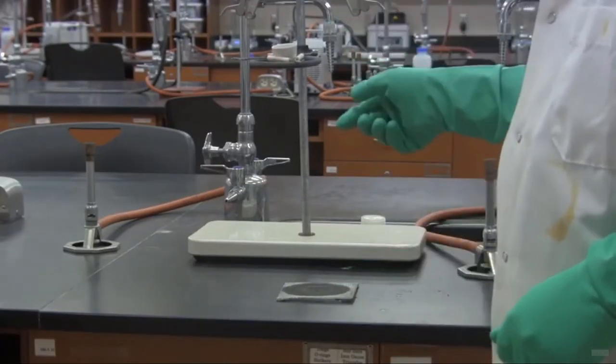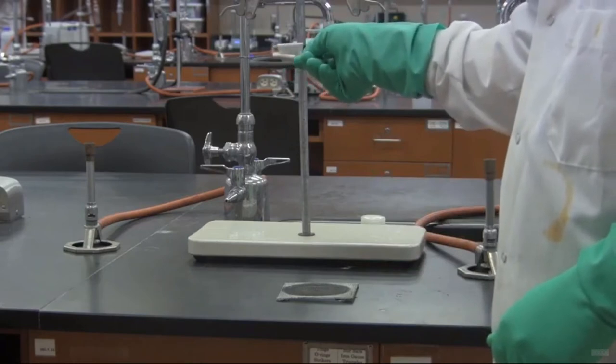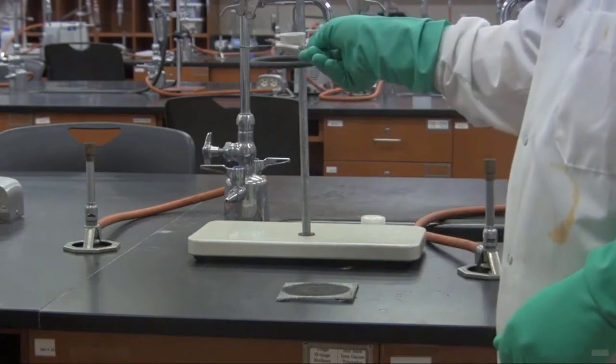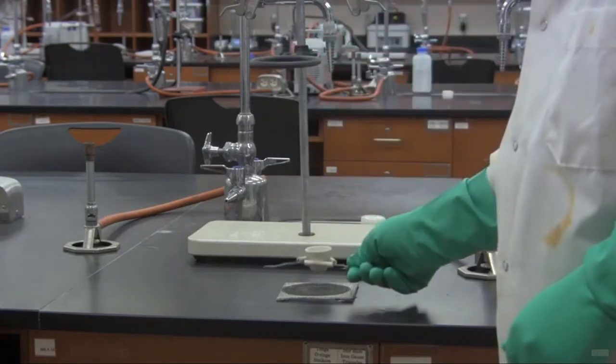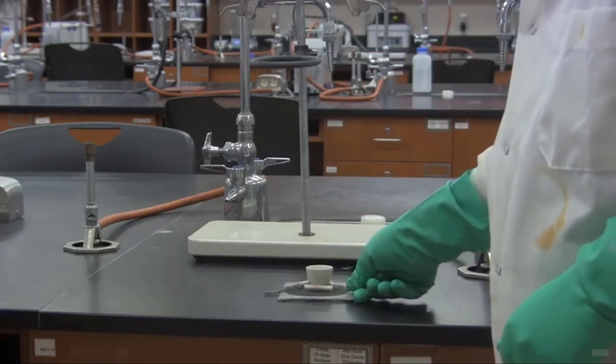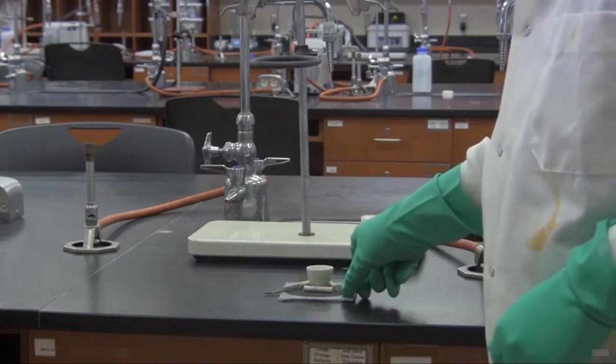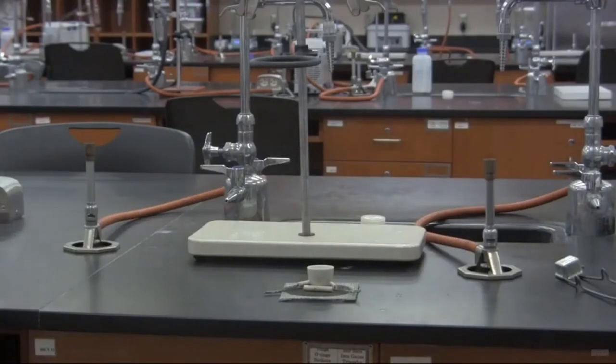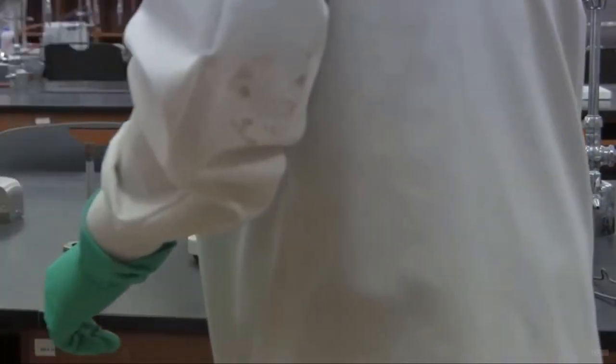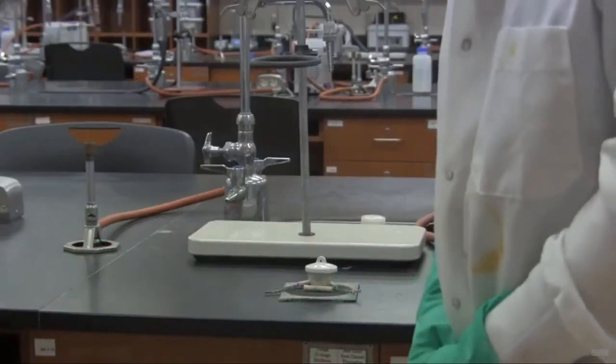At this point I've finished heating it. It's brown on the inside, just like I showed you in the last shot. And it's been cooling for a bit. Now I'm going to put it on here to cool. There we go. And now I can put the lid on it. And I'm going to let it cool for 15 minutes.